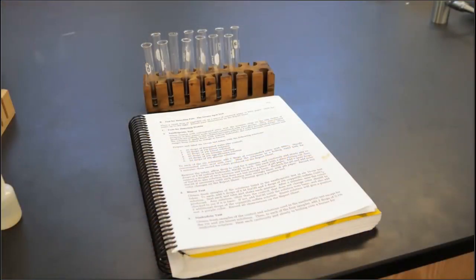So we heated the solutions in a boiling water bath for 3 minutes. And now we will remove the tubes and allow them to cool. And then we will cautiously and slowly add 15 drops of 6 molar sodium hydroxide to each of the test tubes. And then you will want to stir each with a glass stirring rod and remove a droplet of each solution and touch it to a piece of pH paper.